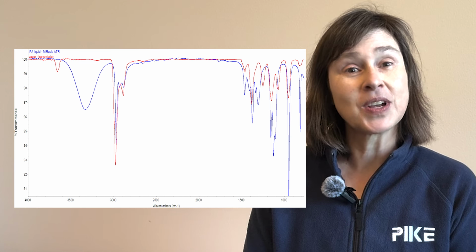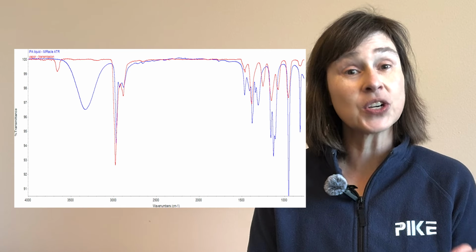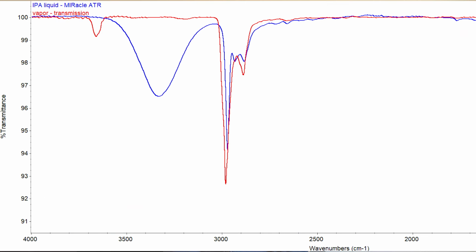Well, it's really easy to tell, and let's take a look at a couple of spectra and you can see for yourself. So I collected two today, one in the liquid phase using the Miracle Single Reflection ATR, and I also collected a spectrum of IPA vapors just in transmission. I used 8 wave number resolution. Now notice at the higher wave number, especially at 3700 wave numbers, there's a band in the vapor that's not in the liquid. Now this band is the non-hydrogen bonded OH stretch.